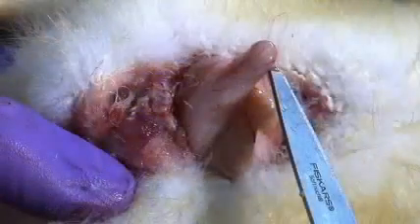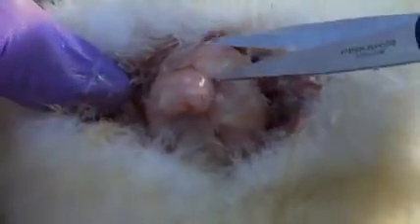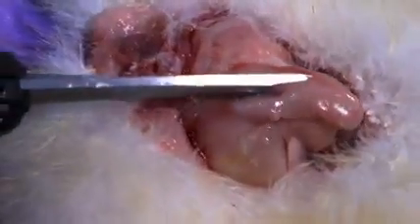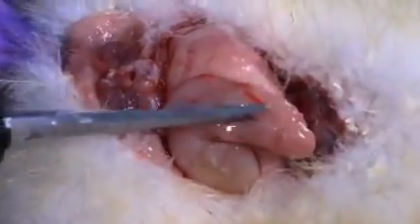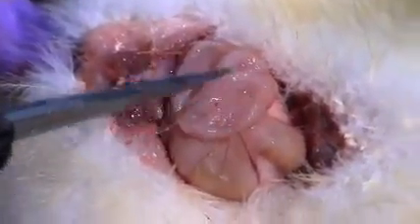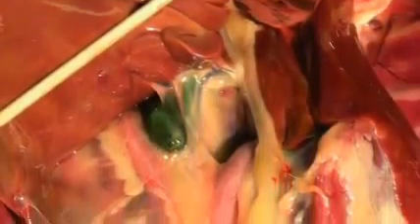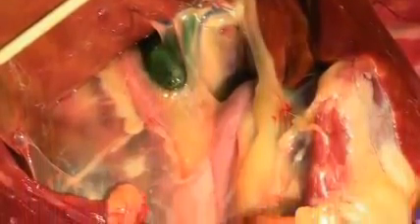It reaches its maximum size at approximately 4 to 12 weeks of age and normally regresses by the time the duck reaches sexual maturity. Make an incision through the outer wall of the bursa and examine the mucosa carefully, looking for any hemorrhages or other lesions. The remainder of the necropsy exam in the duck should be conducted in the same manner as the procedure demonstrated in the chicken.